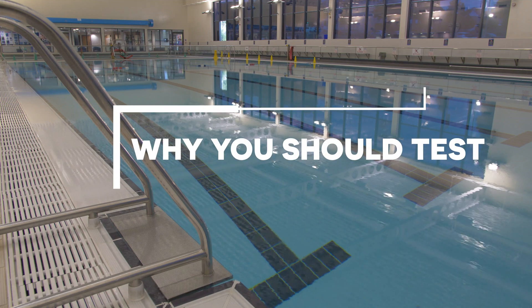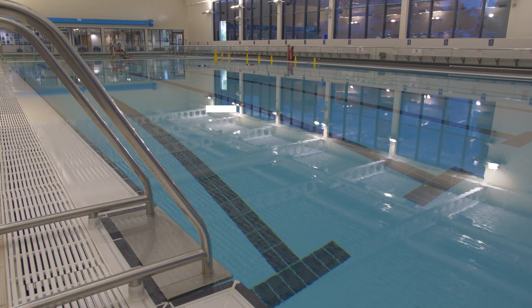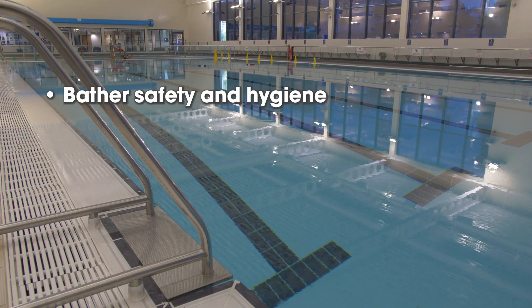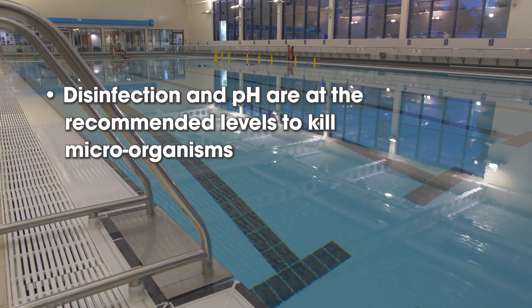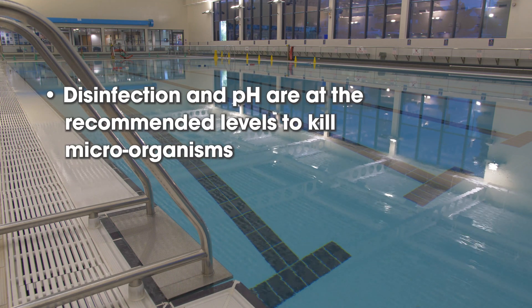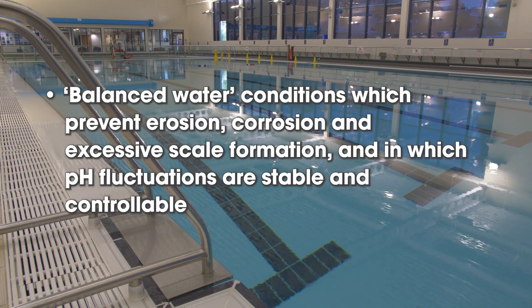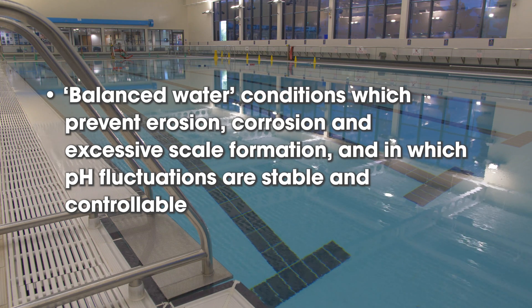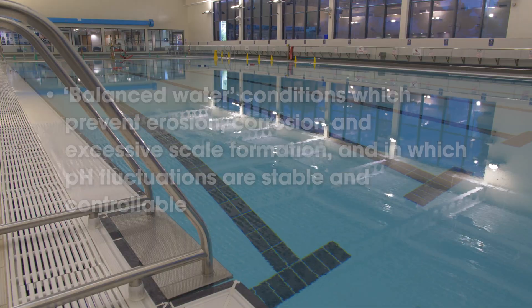The various water tests are carried out to ensure bather comfort, bather safety and hygiene, and that disinfection and pH are at the recommended levels to kill microorganisms. They also ensure balanced water conditions which prevent erosion, corrosion and excessive scale formation, and in which pH fluctuations are stable and controllable.